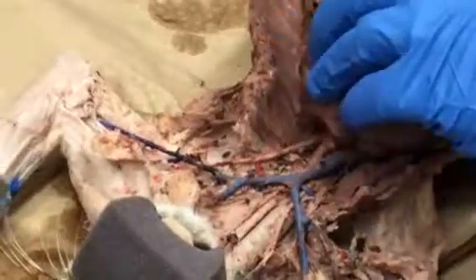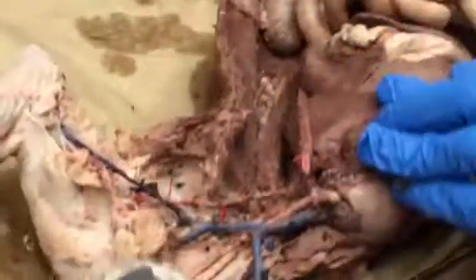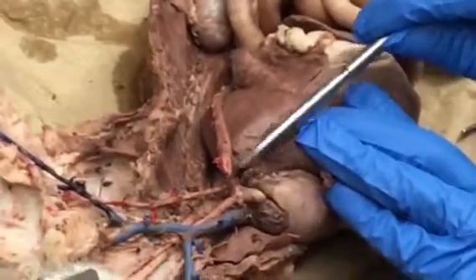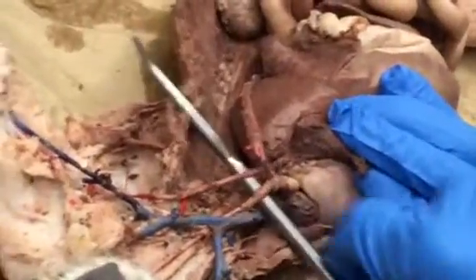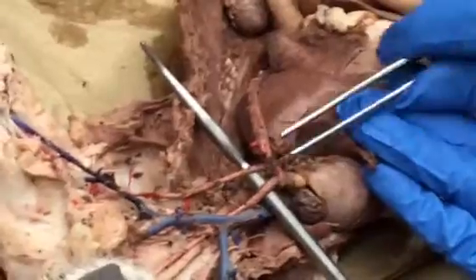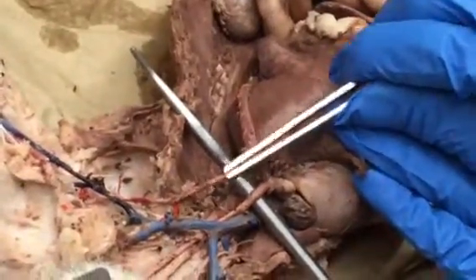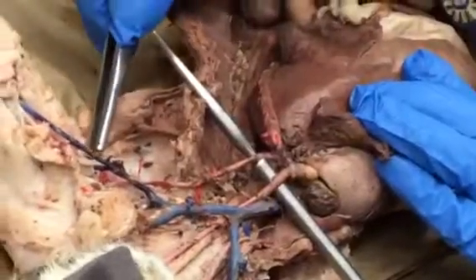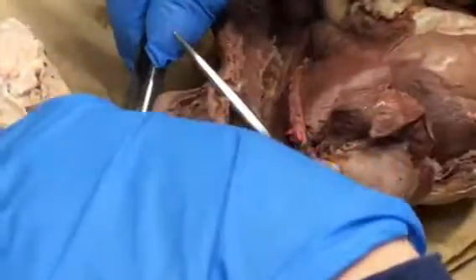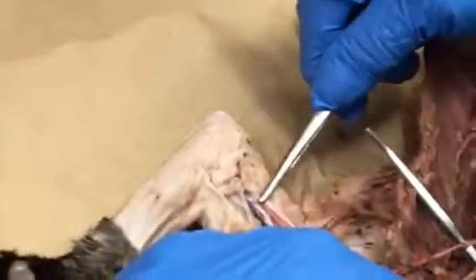We're going to start at the heart, and I'm going to pull the heart towards me so that you can see the arch of the aorta, and that's here. Here's the arch of the aorta. What we're going to see are two vessels coming off the arch of the aorta. Branching left, we see the left subclavian artery. That goes up and over the ribs into the armpit area as the left axillary artery. Farther down in the arm, it's the left brachial artery.